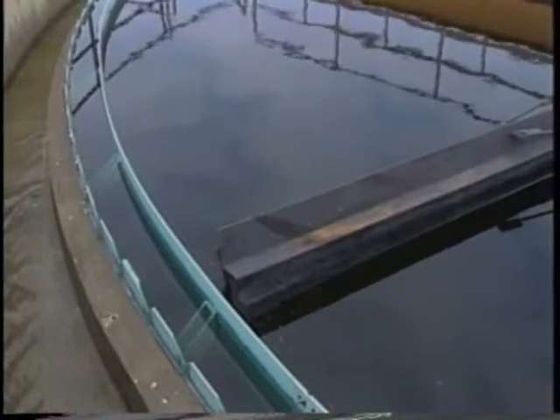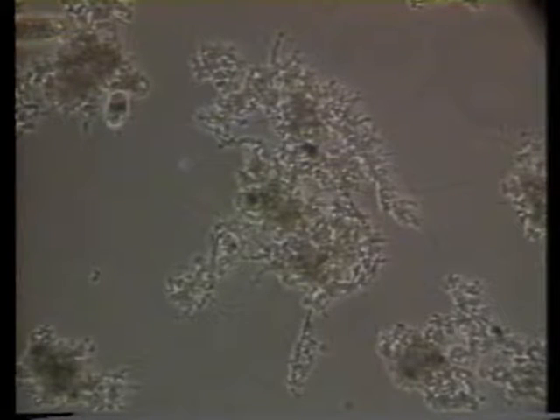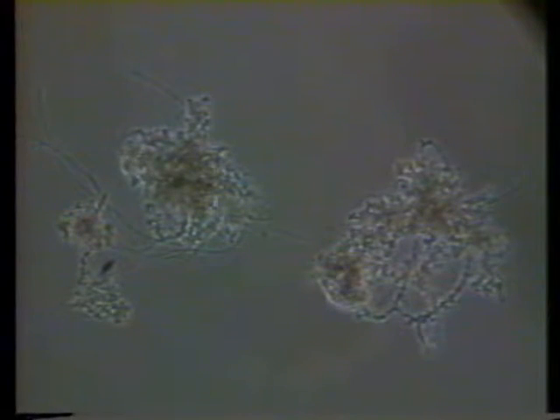Another factor which also plays an important role in a sewage treatment plant's performance is filamentous bacteria. The amount and type of this bacteria in a facility's activated sludge determines the type of floc structure which will develop. A balance of filaments and microorganisms will yield a good settling sludge and a clear effluent. A moderate number of filaments serve as a backbone for good floc structure. However, too many filaments can lead to poor sludge compaction and sludge bulking.